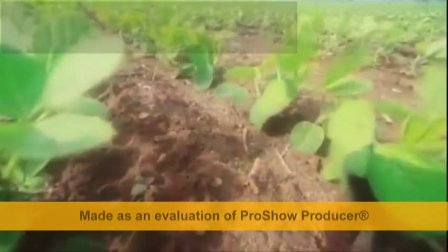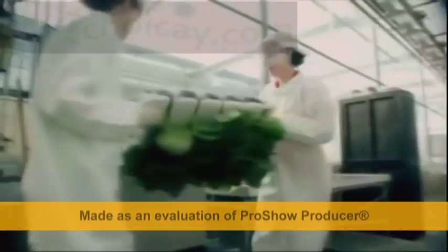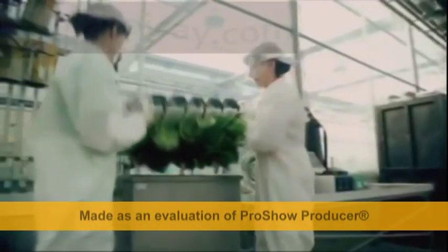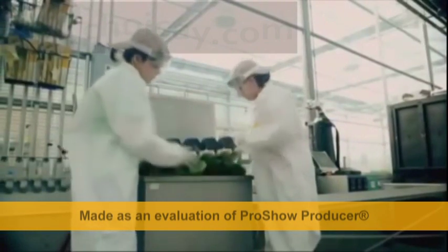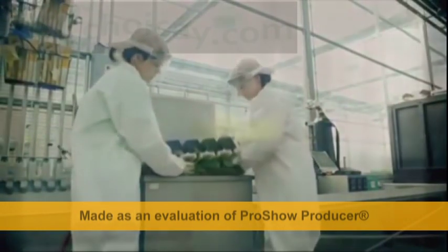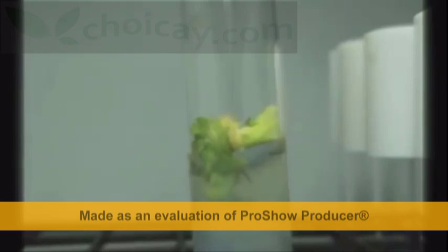Today, plant tissue culture has been remarkably essential in agricultural biotechnology. It allows regeneration of a plant in an in vitro condition to occur.